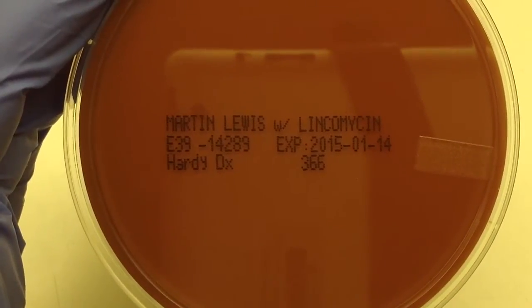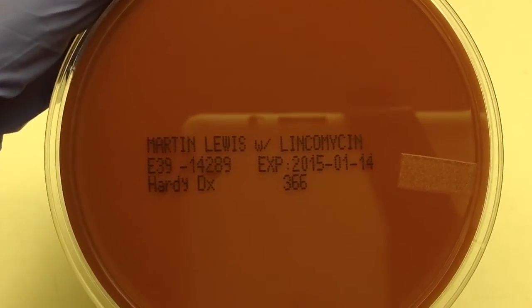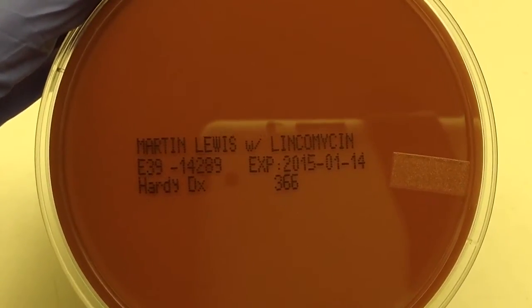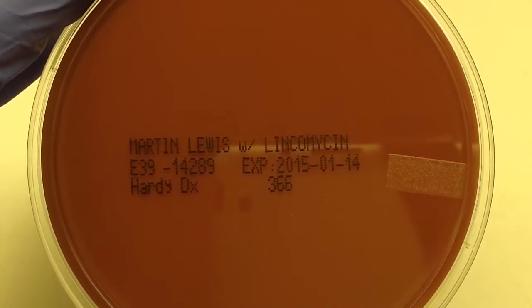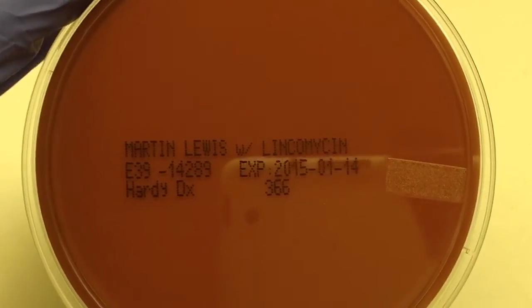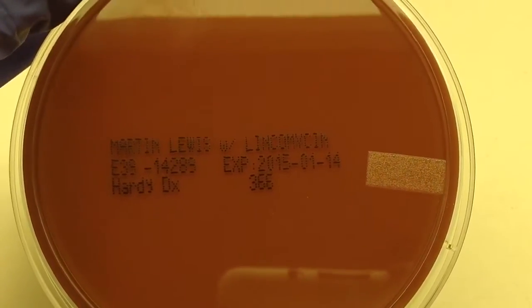This is a Martin Lewis plate. This is used for culturing suspected gonococci, Neisseria gonorrhoeae. This is also a selective media, meaning that it's going to inhibit gram-positive organisms. And it's also going to be enriched, meaning that it's going to help Neisseria gonorrhoeae grow.